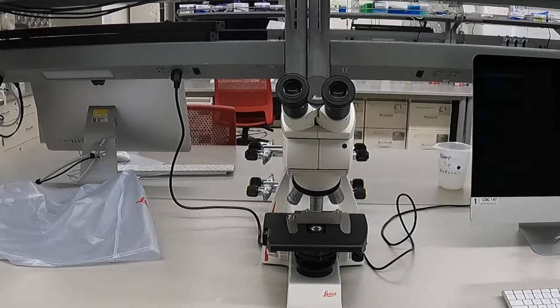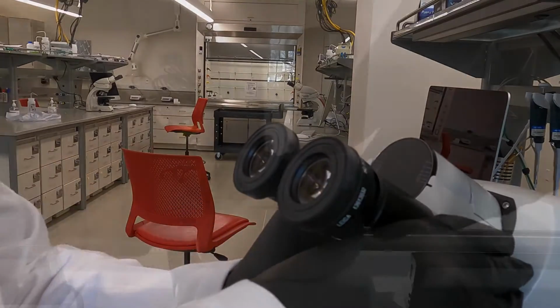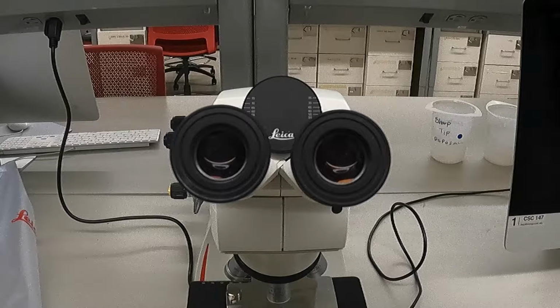The first step towards being able to comfortably and confidently use a microscope is to know what the different parts of the scope are and what each part does. The first component we'll cover is the eyepiece, which can also be referred to as the ocular lens. This has a 10 times magnification and can be adjusted for comfort as shown here. Additionally, since variations in vision between eyes can exist for a given individual, each eyepiece can be independently adjusted from the other to allow for optimal clarity. If this adjustment is needed, please ask your TA for more information.